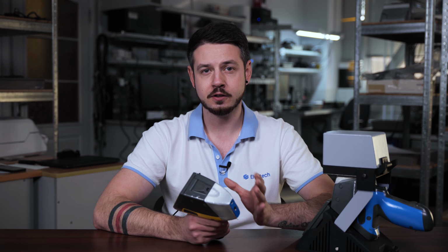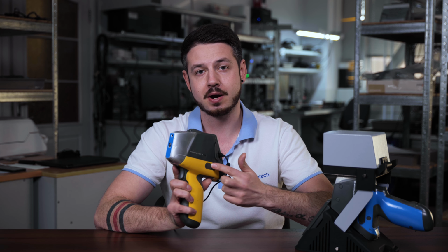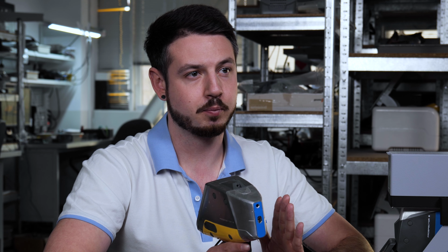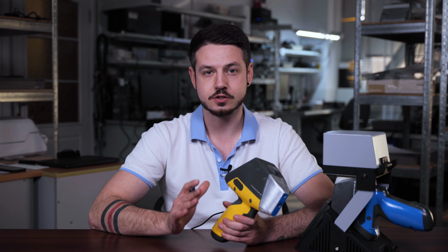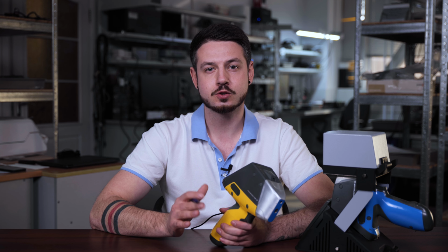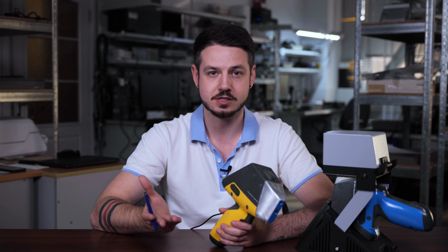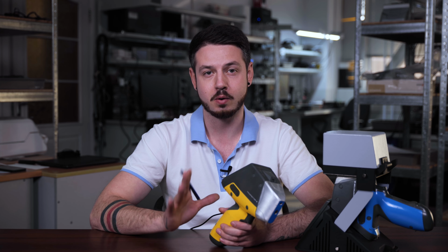After unpacking the analyzer, we need to turn it on. To do this, just press the power button on the left side of the device. It is especially important not to hold it in order to avoid loading errors. Once the analyzer is turned on, you will be asked to enter your password, and then you will need to accept the radiation safety warnings. This is the standard procedure for all of our analyzers.